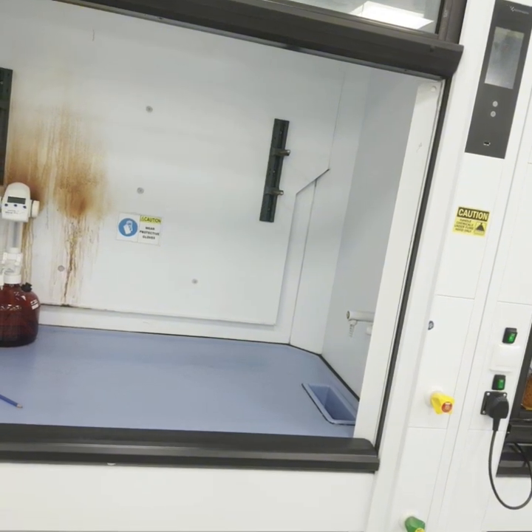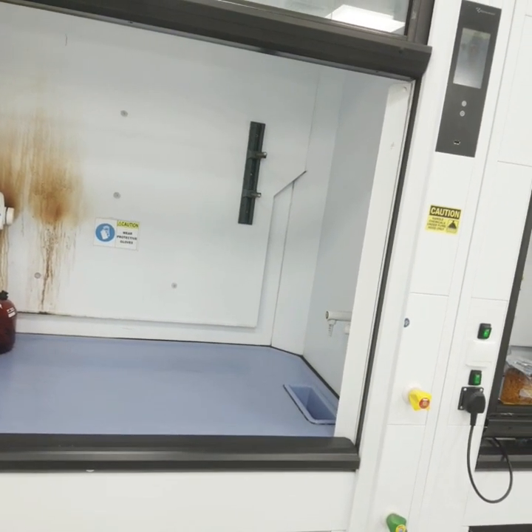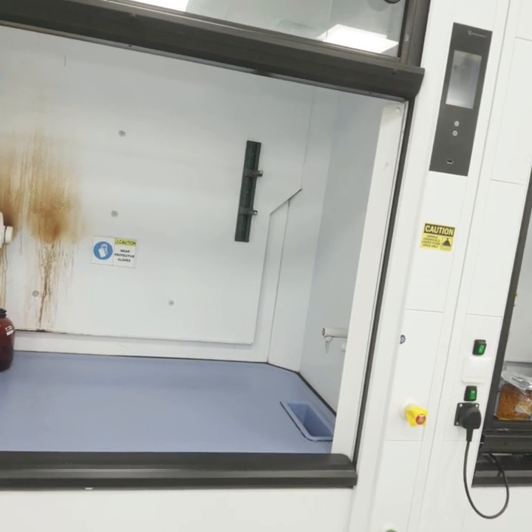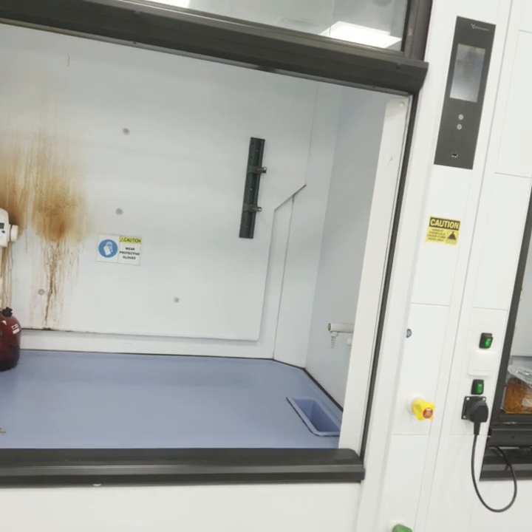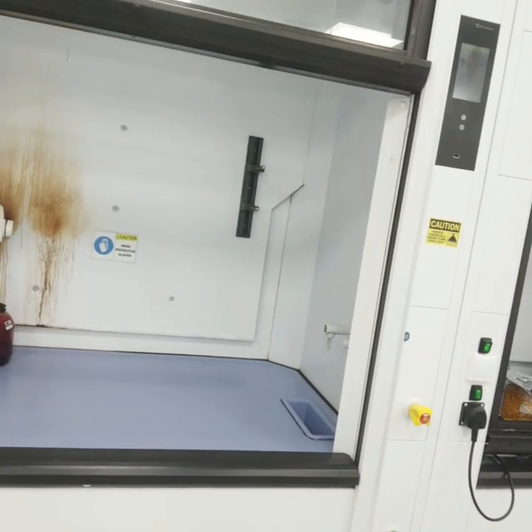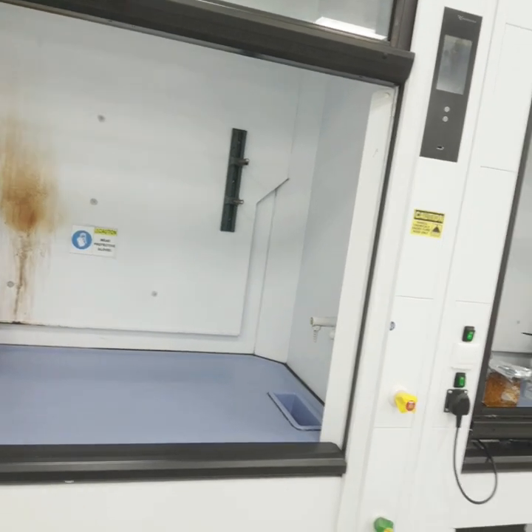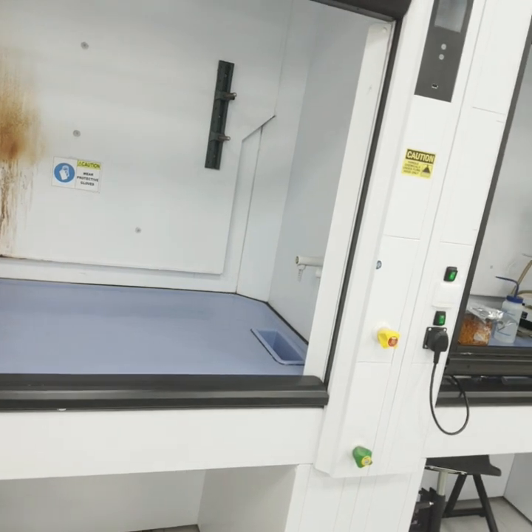From the factory, there is no spark potential on the inside of a standard chemical fume hood. It maintains a continuous stream of clean room air, meaning there is very little chance of flammable combustion inside a chemical fume hood. Now, what PPE is required when using a fume hood?